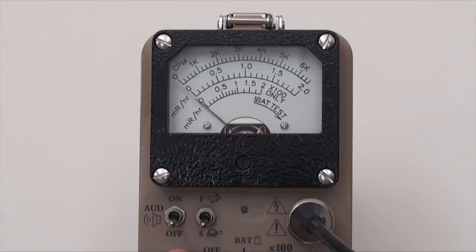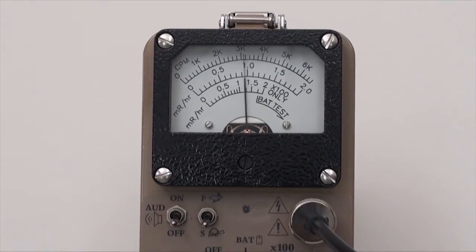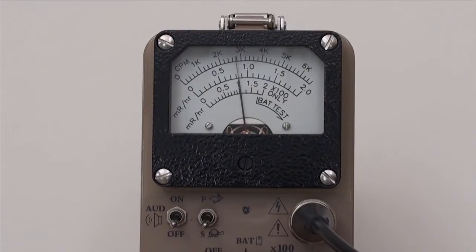A momentary press of the reset button zeros the meter any time you wish to clear the counts to either retake or start a new measurement.